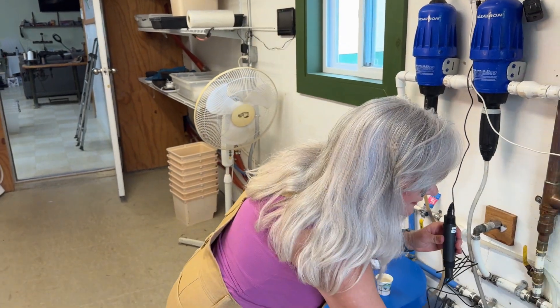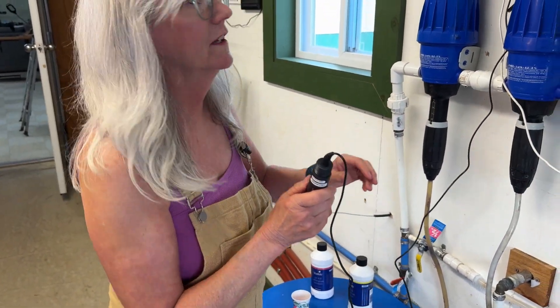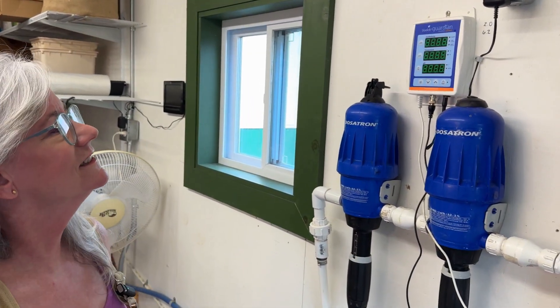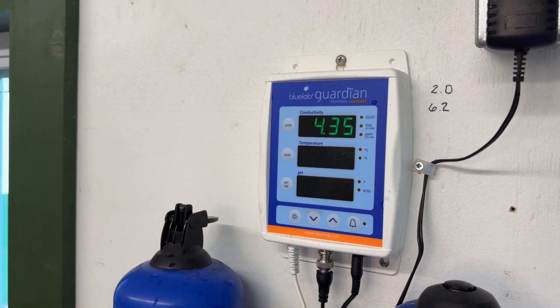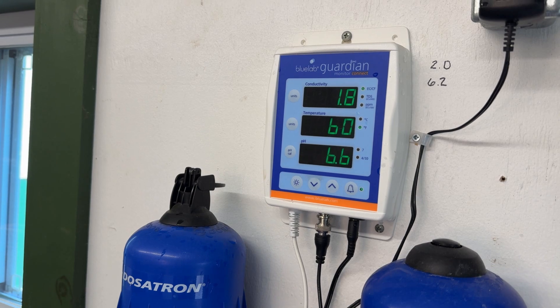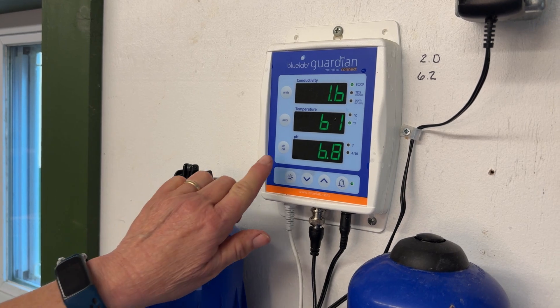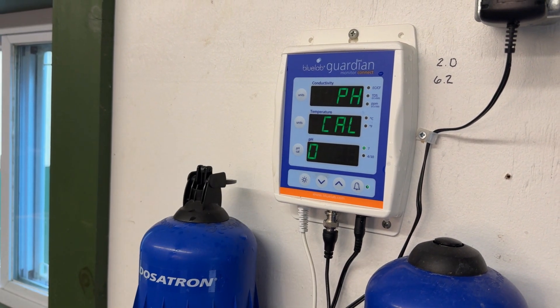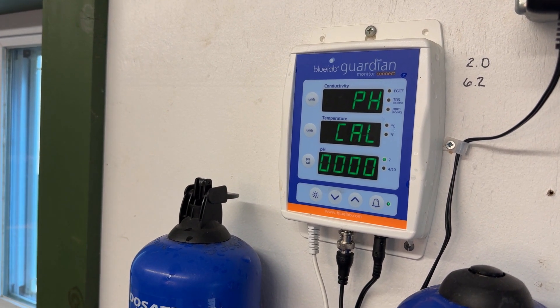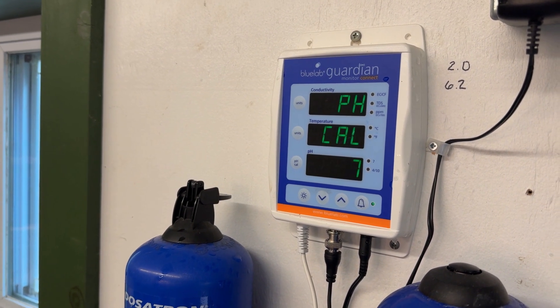Take off the storage solution, dip it in some fresh water, put it in the 7.0 calibration solution. I forgot to plug it in — just get it plugged in. Let it reset. Now I'm putting in the 7.0 solution. This is a lot closer — this is usually where it is when you start calibration. Numbers stabilized, so I'll go ahead and hit the pH Cal button. Hope we don't get any errors. Doing the calculation. Yes! Perfect.